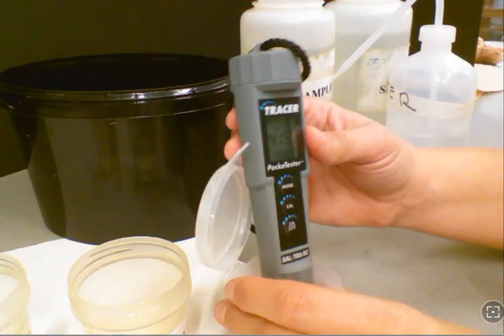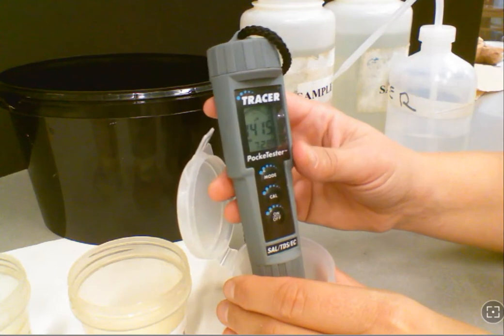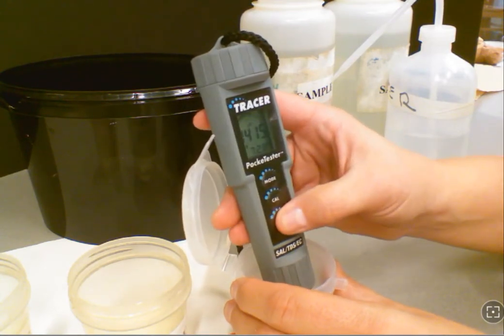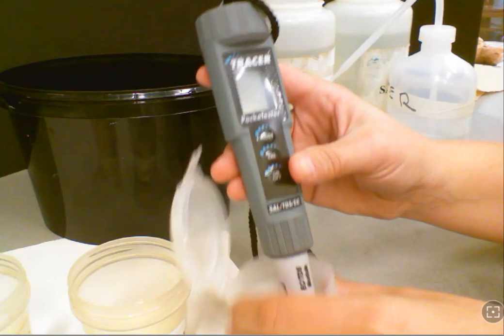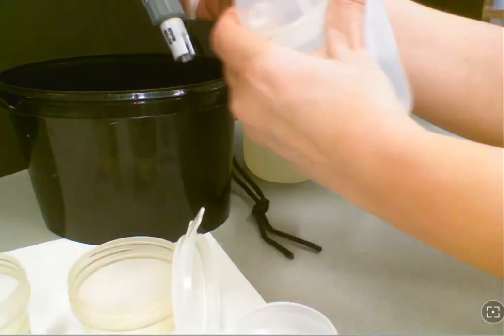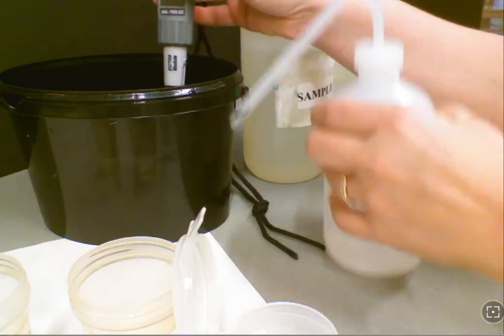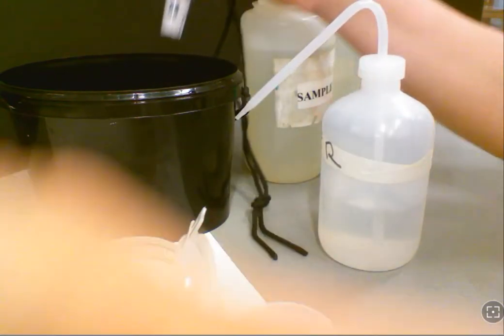Reminder: at the end of your calibration, it'll flash 1413 and SA and END at the end of calibration, and your meter will stop blinking. At this point, you're going to turn your meter off and rinse it with distilled water again. Then we can go ahead and begin working with Sample A and Sample B.